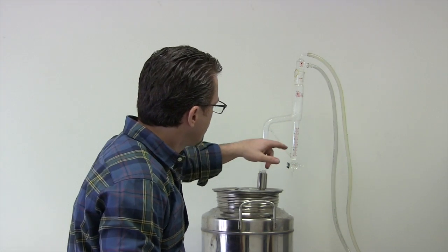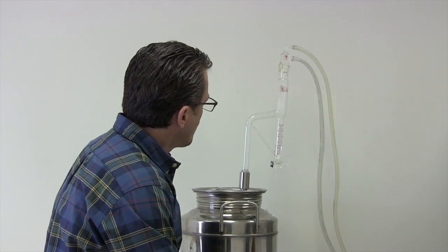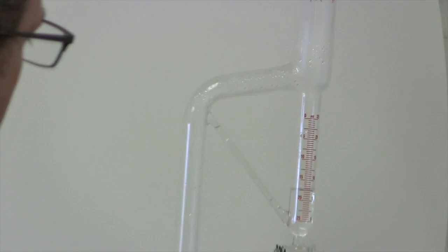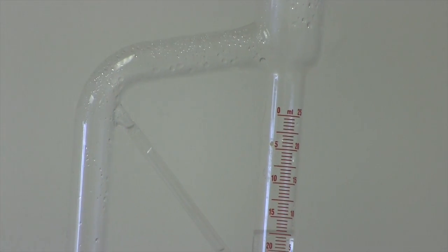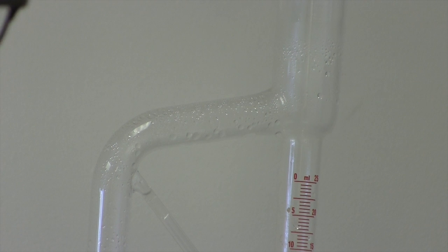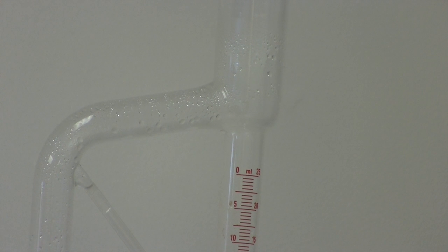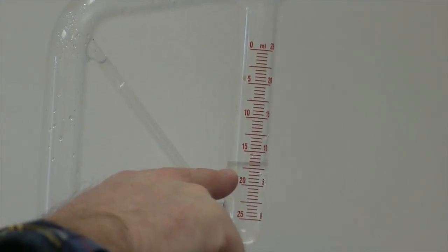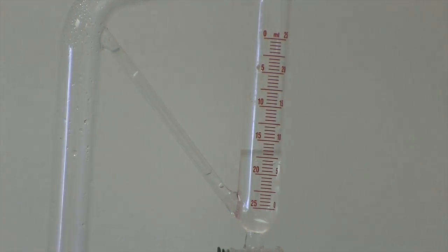So as you can see now, the droplets of oil are starting to come over. And very soon, it will start to rapidly come over. I don't know if you can zoom in and see anything in there. It's kind of cloudy right now. You can see just the beginnings of the oil layer now forming on top of the water.